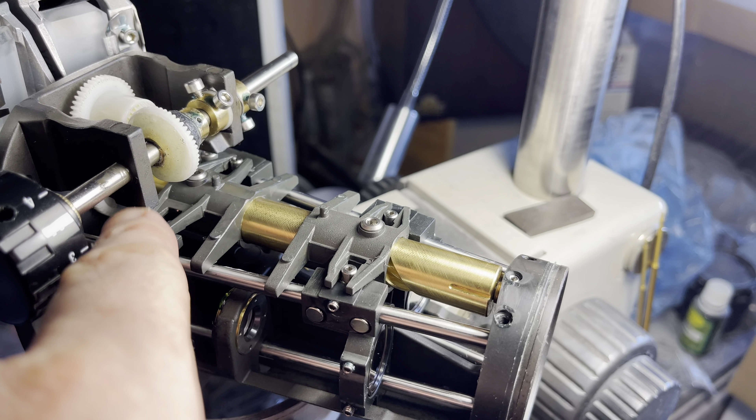After the four mirrors, the ray comes to the eyepiece tubes. Notably, Leica eyepiece tubes have no protective glass — the same design choice as modern Olympus units — which gives decent contrast. In fact, Leica's contrast is the highest among at least Nikon and Olympus sets, and the brightness is comparable. Compared to the Olympus SZ 61 or Nikon SMZ 745, Leica's contrast is at least 50% better than Olympus and at least twice as high as the Nikon SMZ 745.